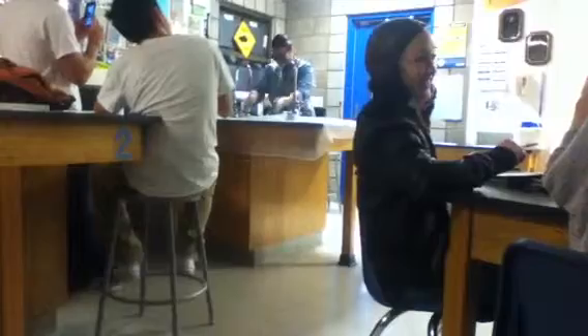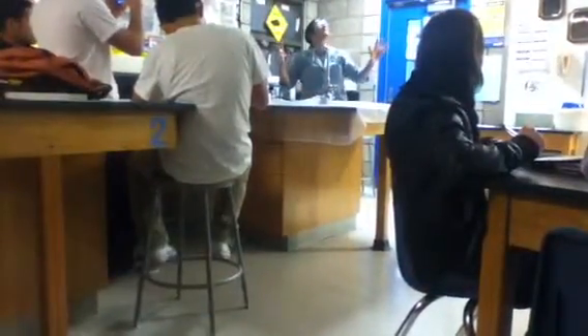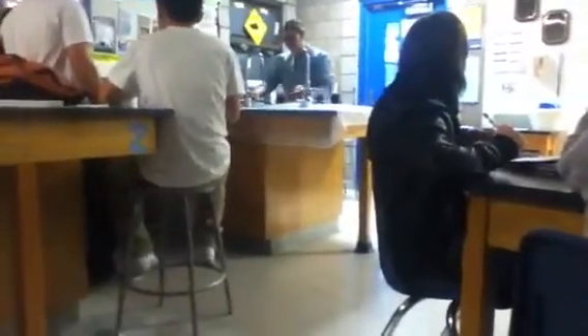Here we go. All right, here we go. Another big one — you've got to do at least a couple so everybody sees at once. It might be a fire alarm — I mean the sprinklers. You've got to get the right consistency. There we go.